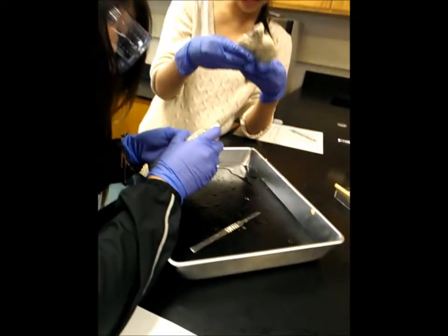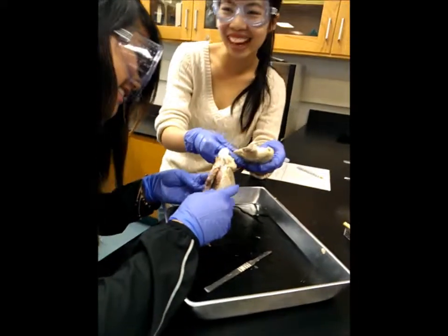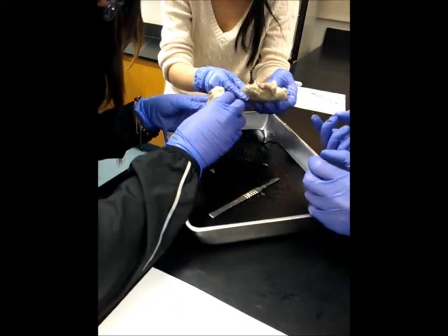I think we broke the little... Did we break it? Like the bicuspid. Bicuspid. We broke it? Oh, I don't know. Yeah.